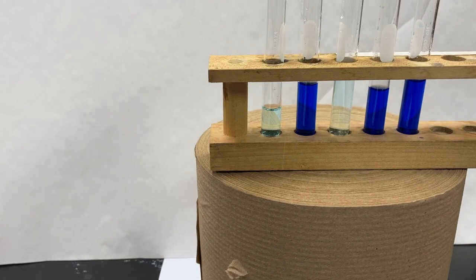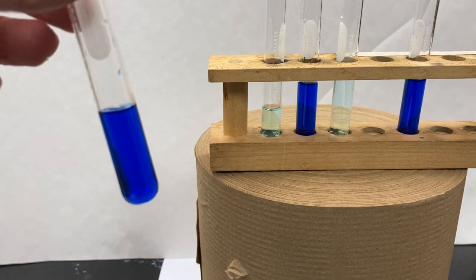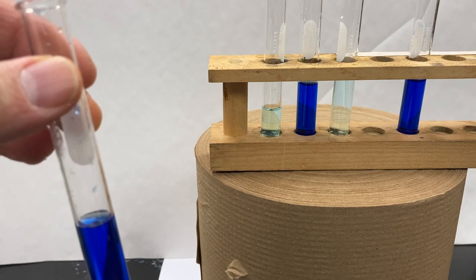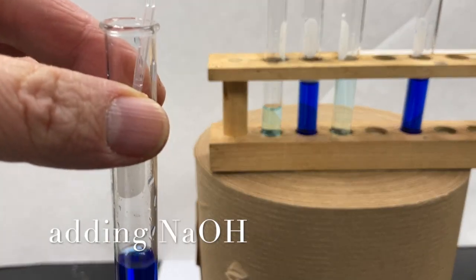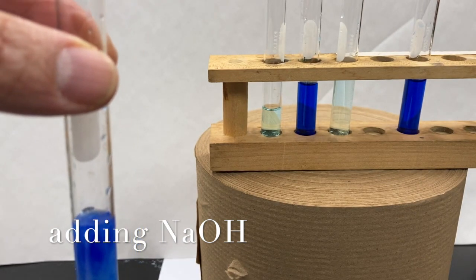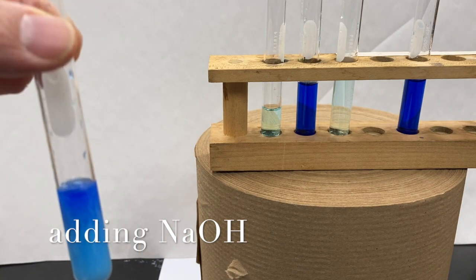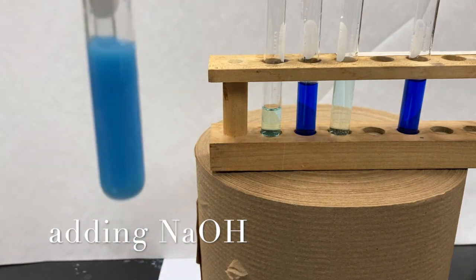Now we're going to take our solution and we're going to add sodium hydroxide to it. Let's see what happens. And as you can see, we get cloudiness forming. Right?